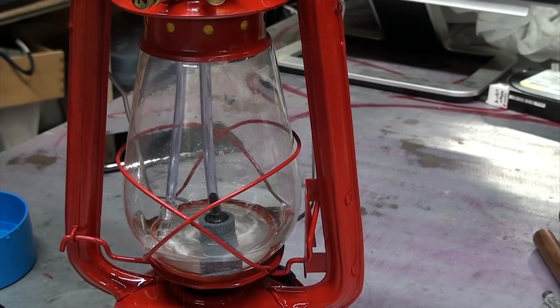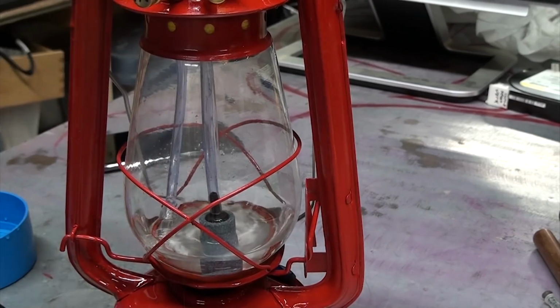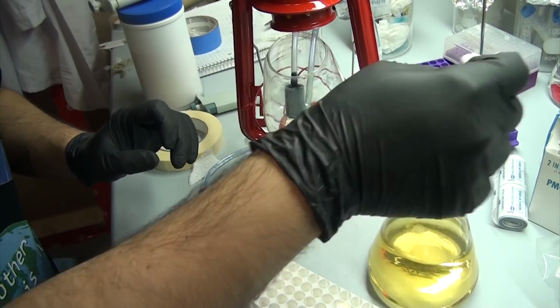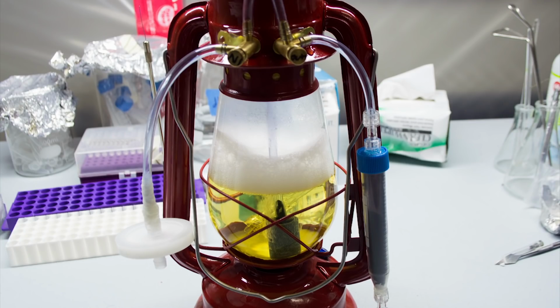For a first fluid and air test, I filled the chamber with water using the main fluid intake port and a syringe, which took ages because I was doing it by hand. But I wanted to make sure that this all worked properly. For later tests, I just open up the system and pour in the liquids. I also added some highlighter fluid to the water to give it a glowing green tinge, which looked amazing with the UV lights on. After fixing a small leak, I was ready to give this a proper test run.